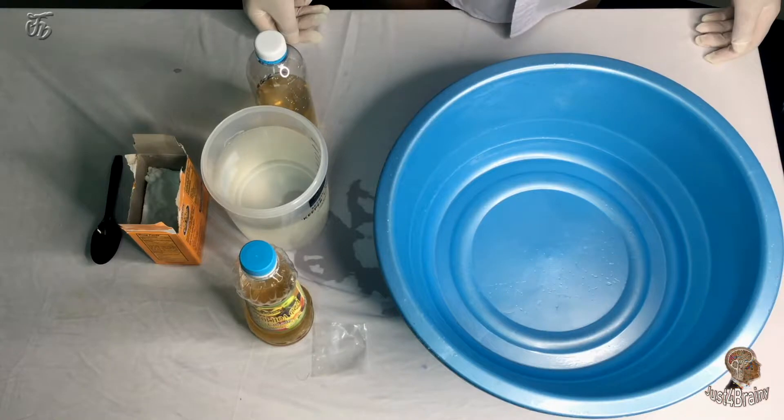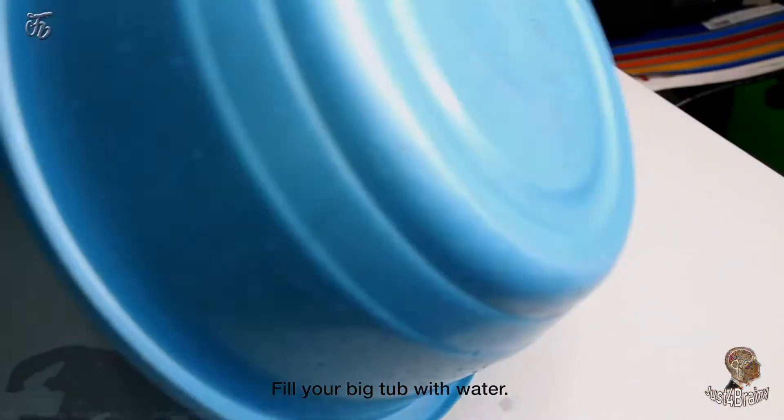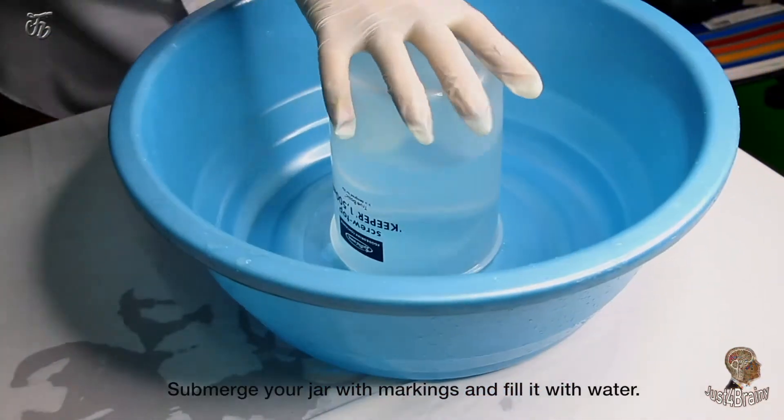Procedure: Fill your big tub with water. Submerge your jar with markings and fill it with water.